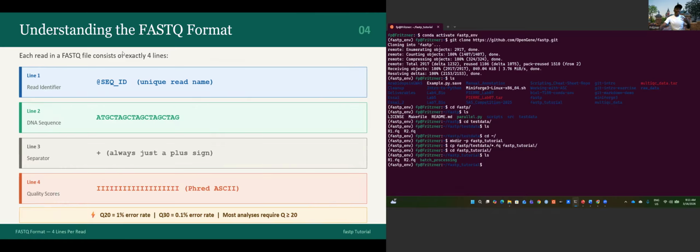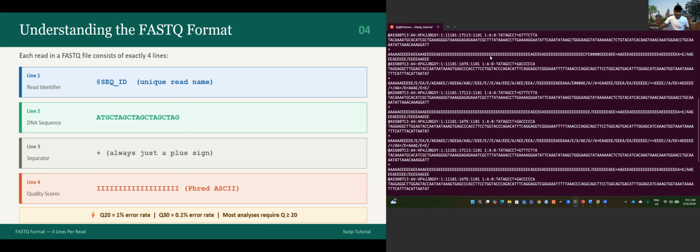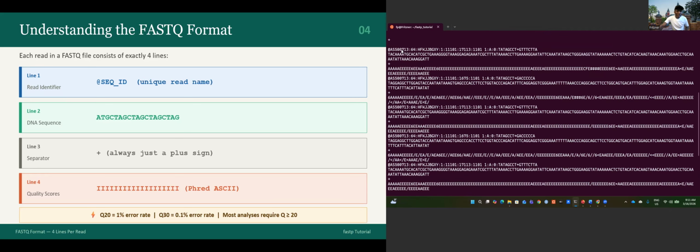Now this is just to understand the FASTQ format. Let's open one of them to compare. We have four lines per read. The first line is the unique read name. Then we have the DNA sequence, the separator that's usually a plus sign, and the quality score. Let's just cat R1. Voila. This is what I was just talking about. This is the first line, the read identifier. This is the DNA sequence. This is the separator. And this is the fourth line, the quality score.